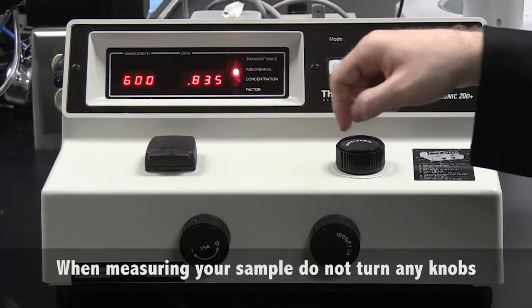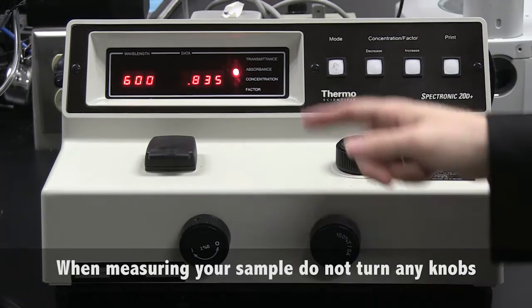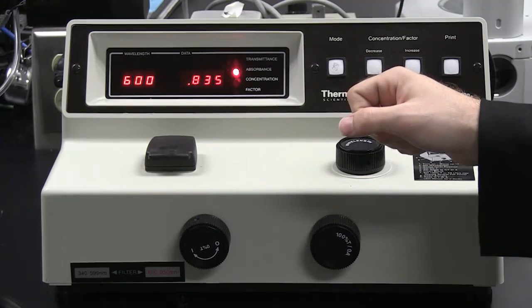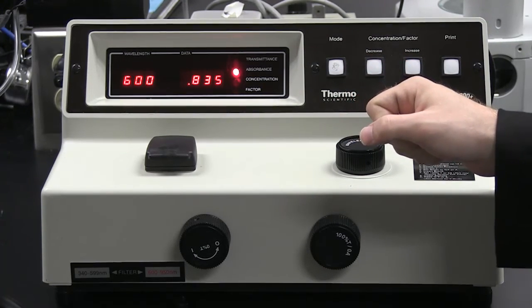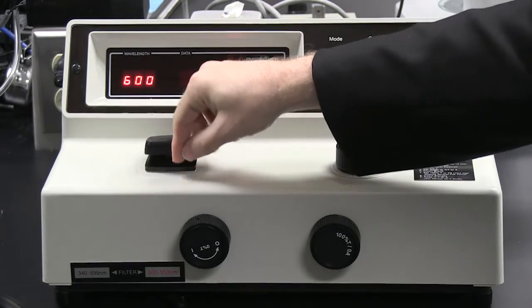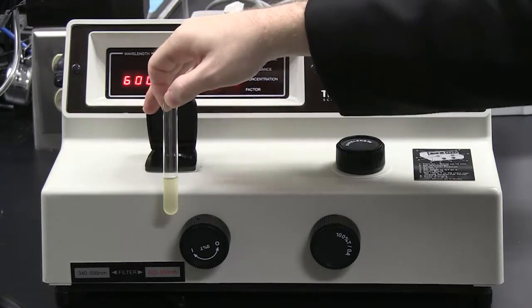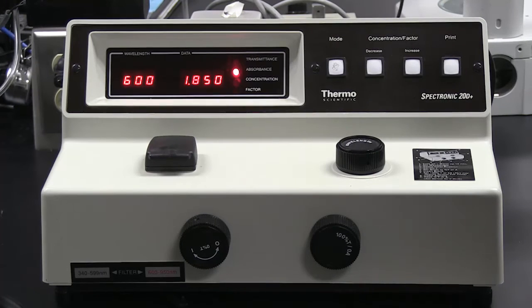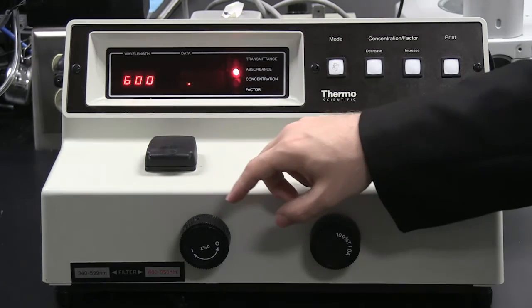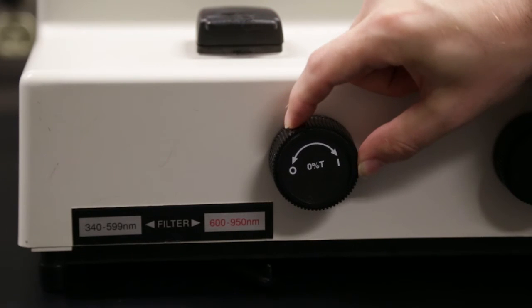Notice I have not touched any of the knobs when making an absorbance reading. In our sample here, this has an absorbance value of 0.835. I open up the sample compartment door, I take out my sample, and close the door. When you have finished using the spectrophotometer, we turn off the machine by turning the 0% T knob as such.